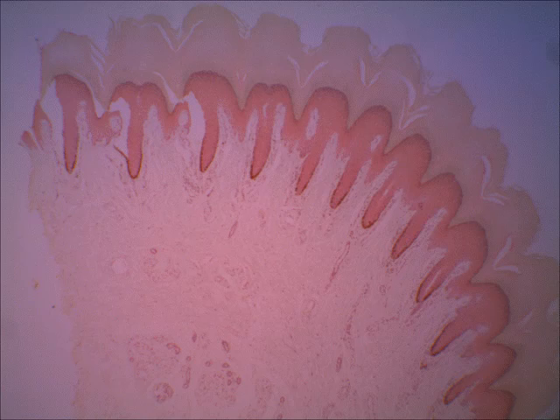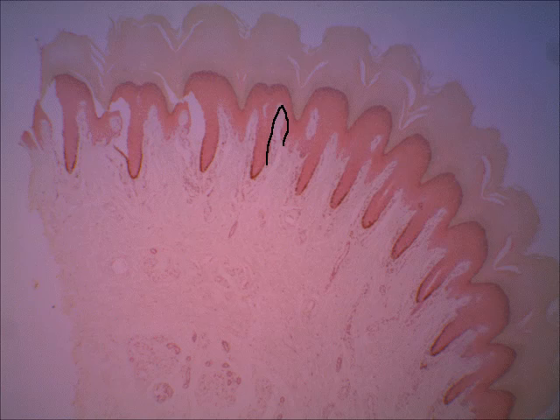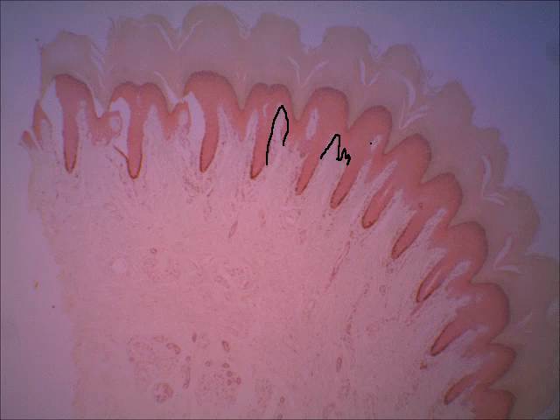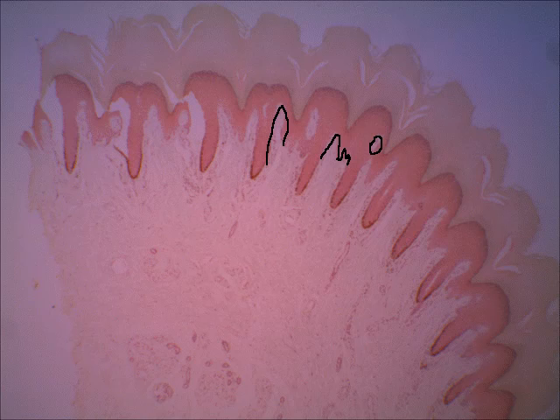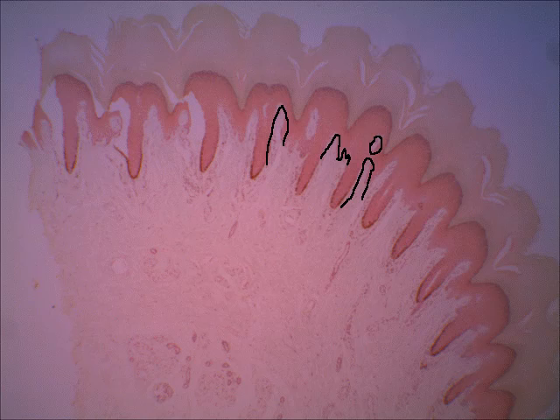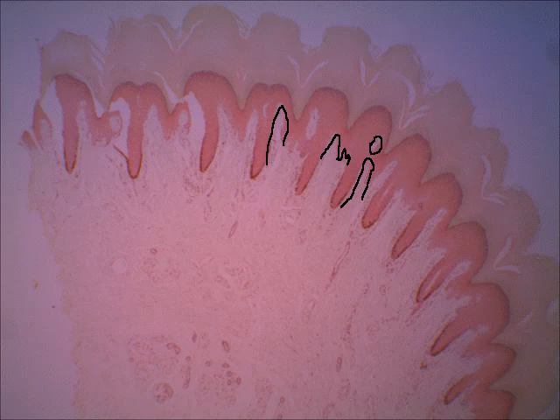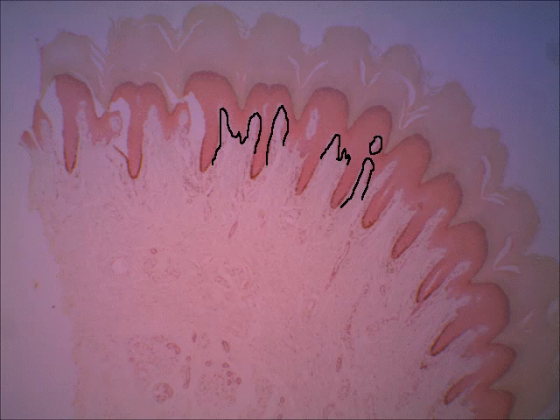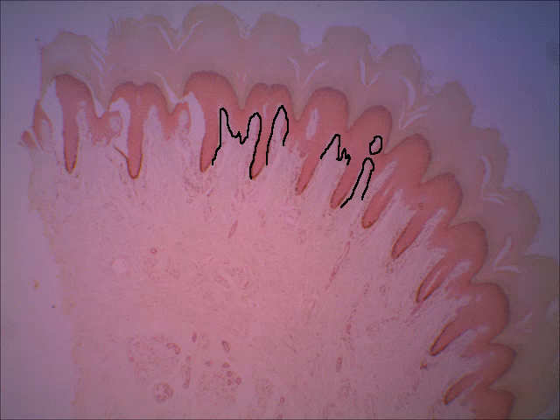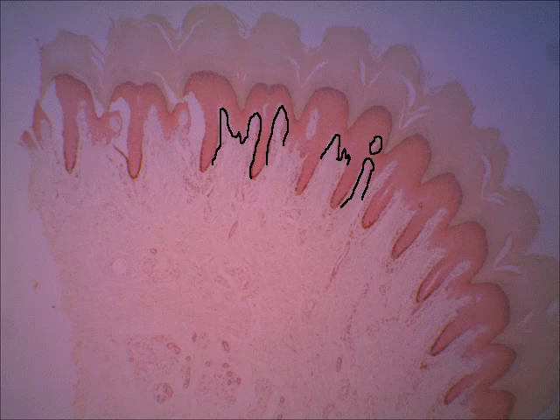Now I want you to notice where the dermis projects up towards the epidermis — right there, and you can see it right here. Because this is a section, it doesn't always go to completion, so you see how one of these little areas gets cut off and then appears again. These areas where the dermis projects up towards the epidermis are called dermal papillae — they are the highest locations of the dermis.